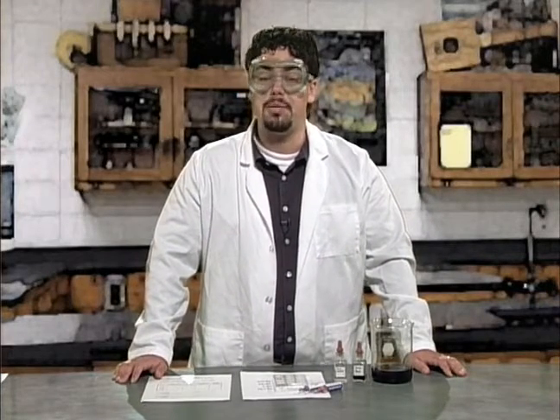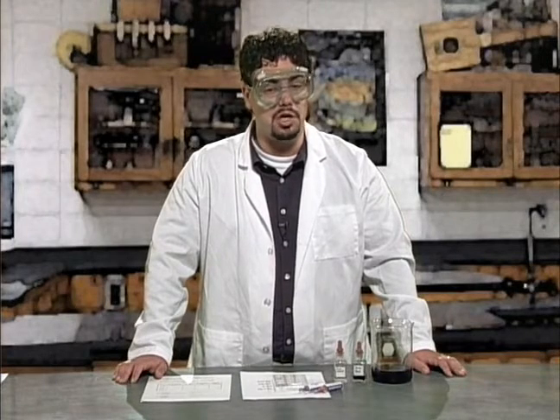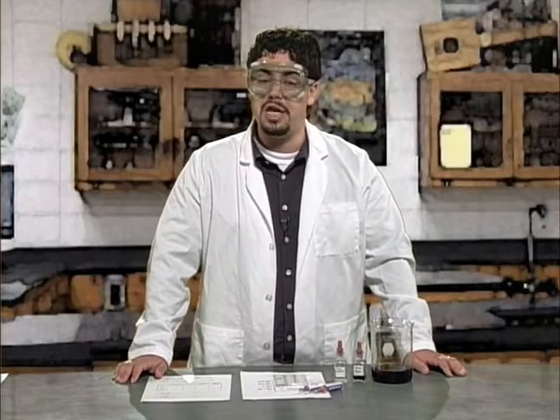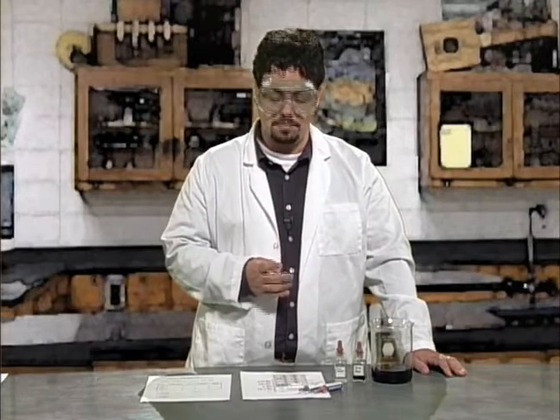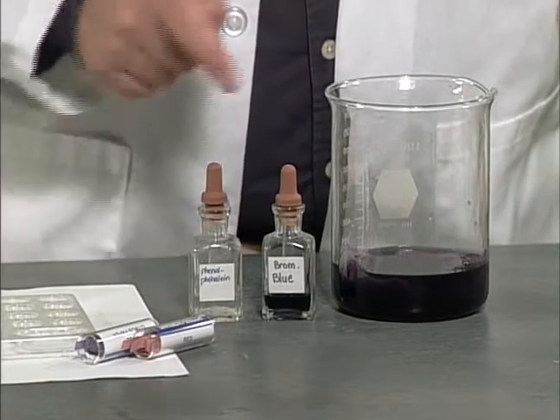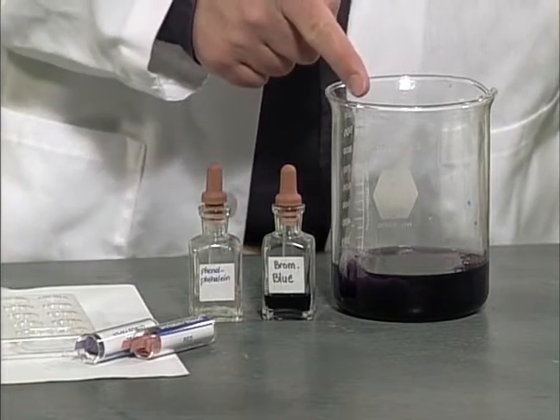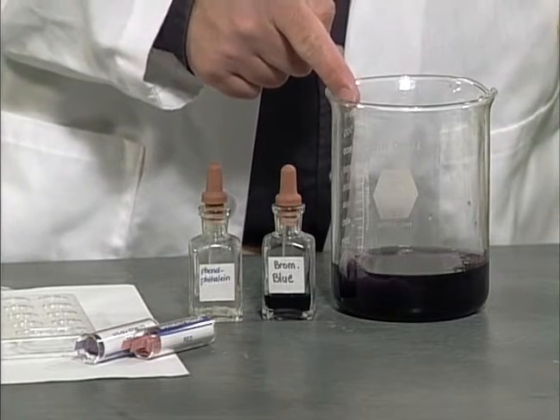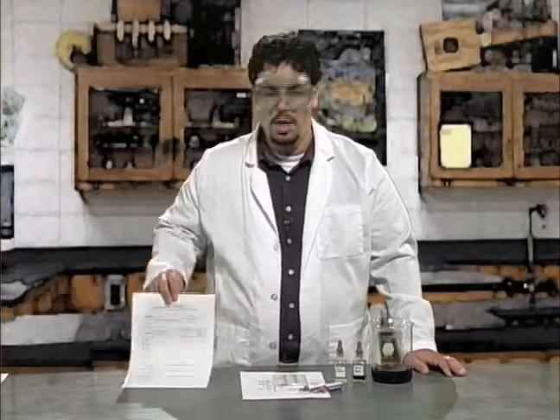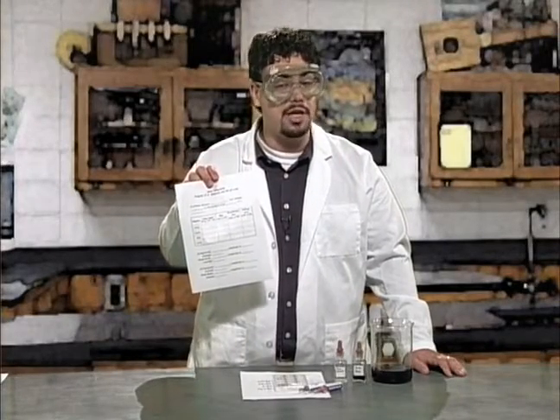I'm going to test some of the acids and bases that were used to develop our operational definition in the last lesson. I'm going to test each one with a set of 4 different indicators: litmus paper, phenolphthalein, bromothymol blue, and my personal favorite, cabbage juice. On your note-taking guide, you will write down the color change for each of the indicators.